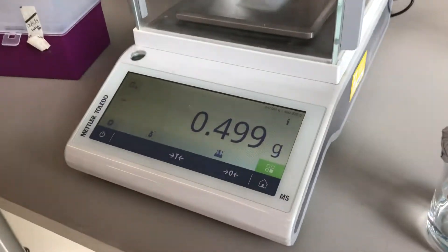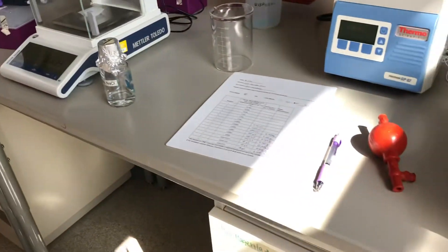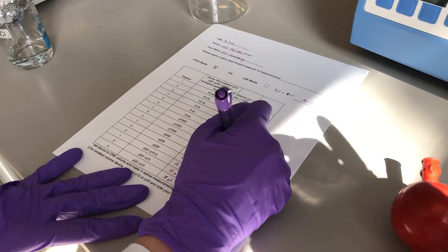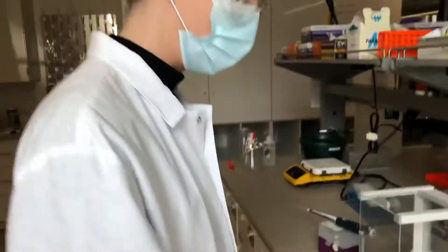Close it, check your measurement, and then record. So we have 0.499 grams. And then repeat.